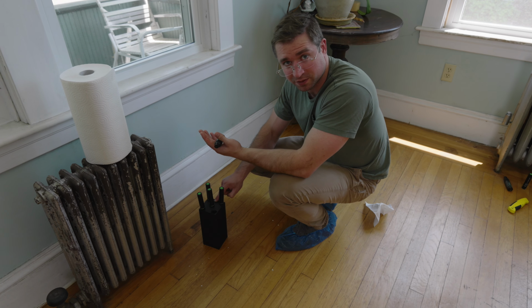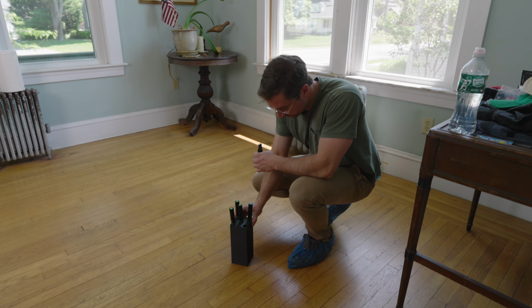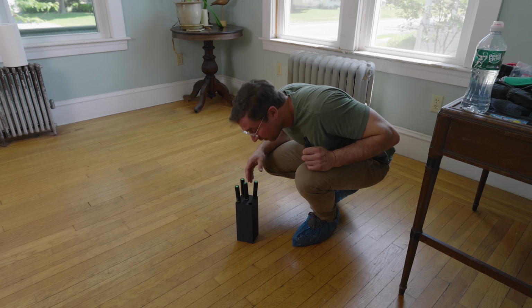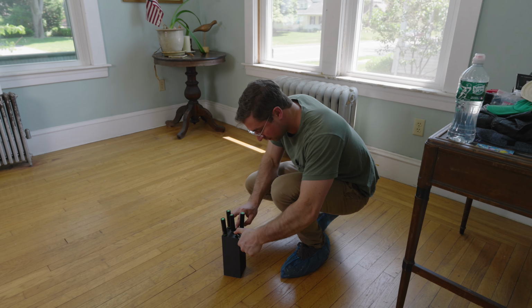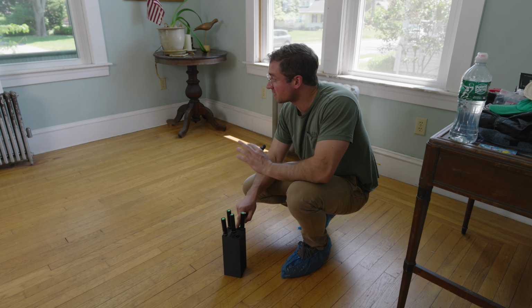So we know that there's a lot of lead-based paint dust by this window, and that makes sense because this window is what caused the hazard to begin with. Let's look elsewhere in the room and see how that looks. So we moved away from the window. Let's test another part of the floor. No fluorescence before. There's still some dust, but much less than over there.